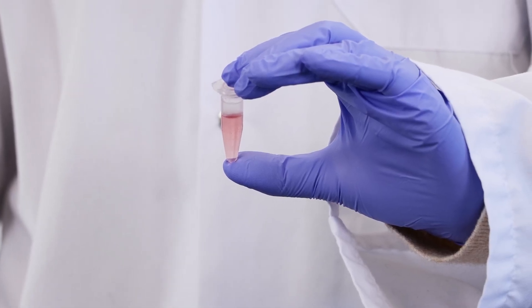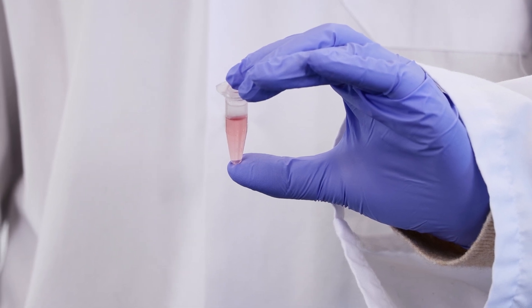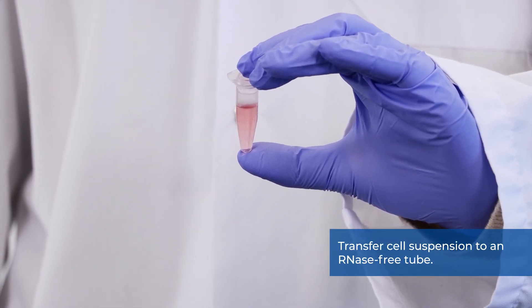First, we will demonstrate cell lysate preparation from cells growing in suspension and lifted cells. Transfer cell suspension to an RNase-free tube.